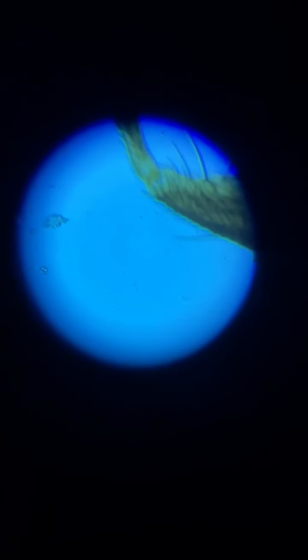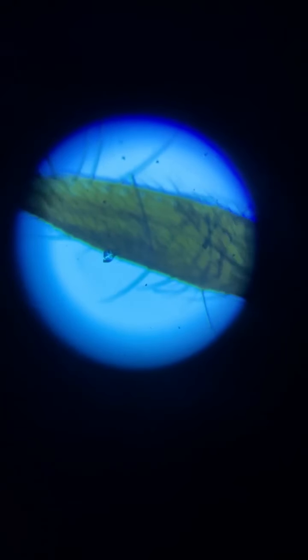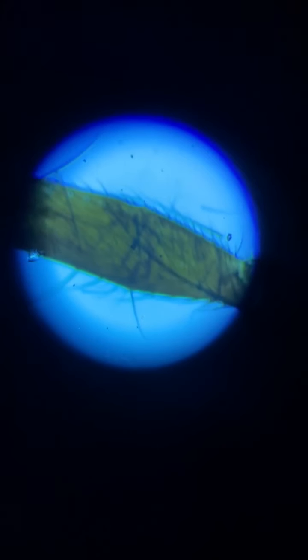Everyone, so I have put my phone into a lens looking into a microscope. The first slide we're going to look at is the leg of a housefly. I deliberately did not put it in focus right now, so you're not going to get the first sight of a big hairy leg, but it's coming. I'm going to now shift the image, getting it into view, and here you can see the leg of a housefly.